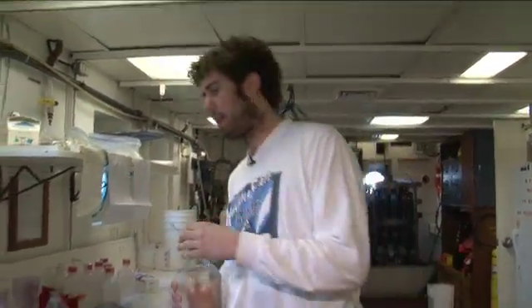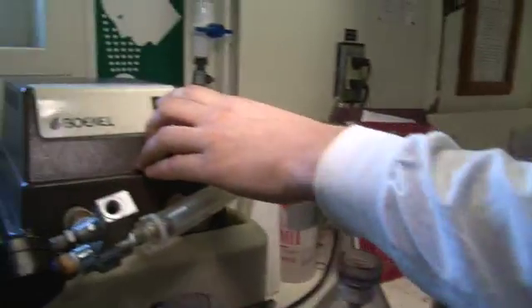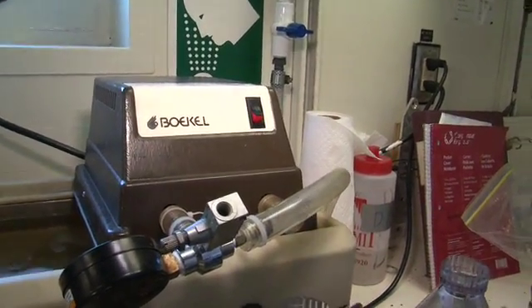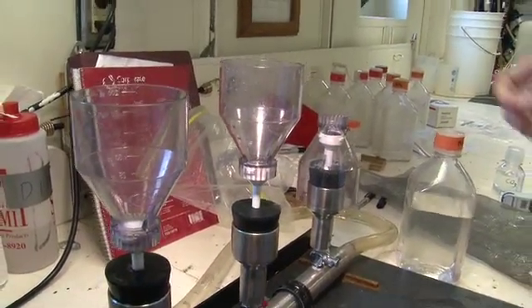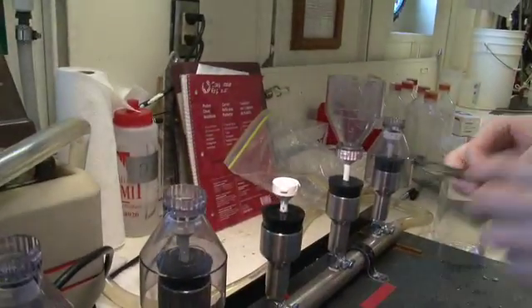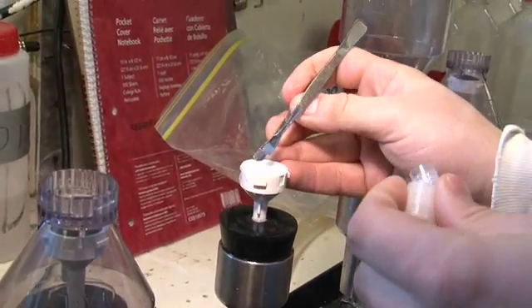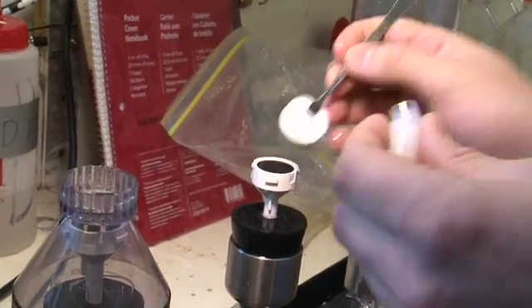After overnight incubation, we bring the sample inside and run it through the filter here — just pour into the funnel and turn the pump on and let it go through. You see the water drains. This is a sample that's already been filtered. You just place the filter into a cryo vial here, and then we store this in the freezer and take it back to the lab to do all the analysis.